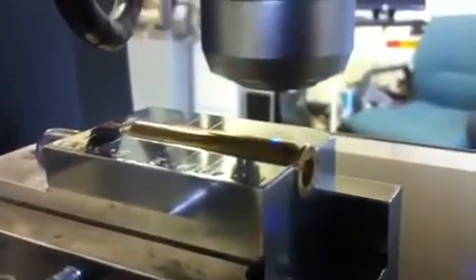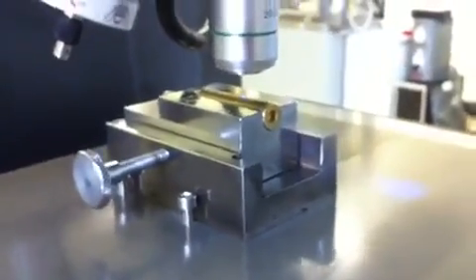Our stage will now navigate back to its first indentation location. The tester rotated to our 20x objective. Moving back over to the computer monitor, you can see that the software is now automatically focusing. And we're automatically measuring each indentation. So now the stage will move back again, the image will display, and we will observe the software collecting the measurements.